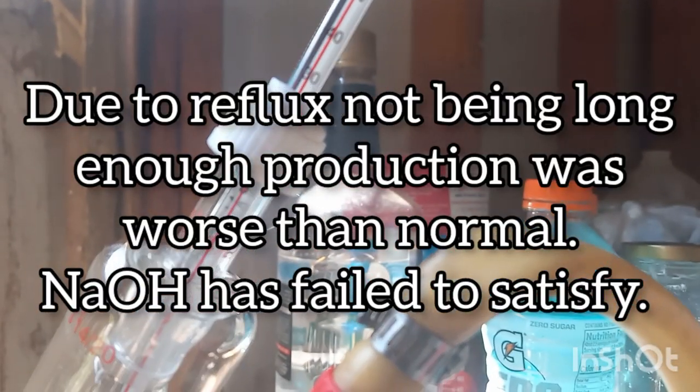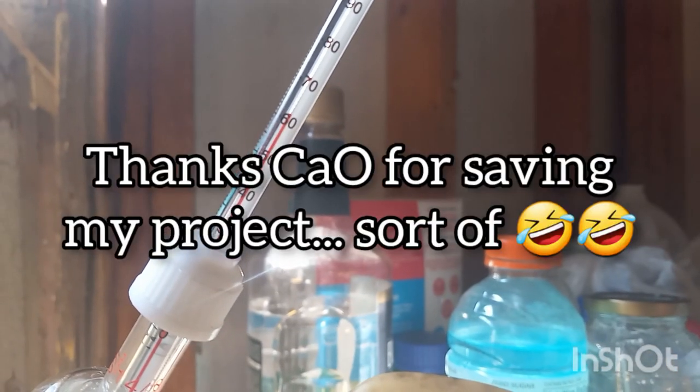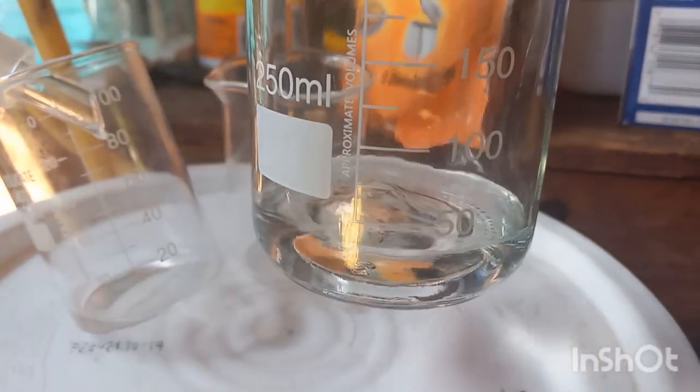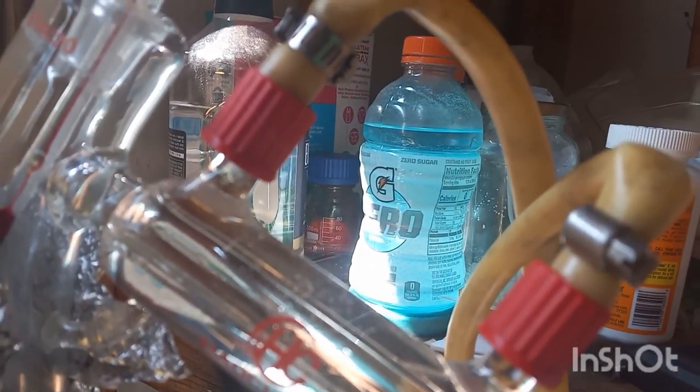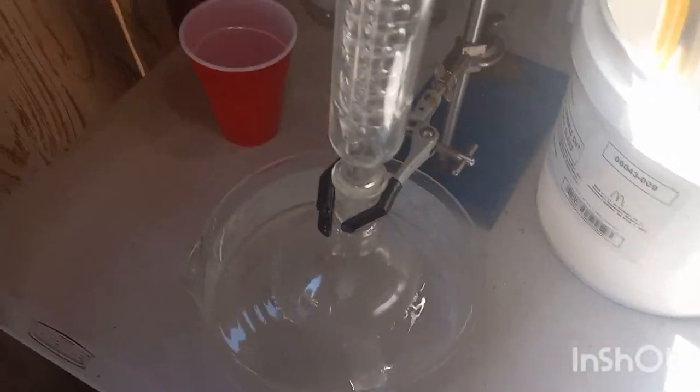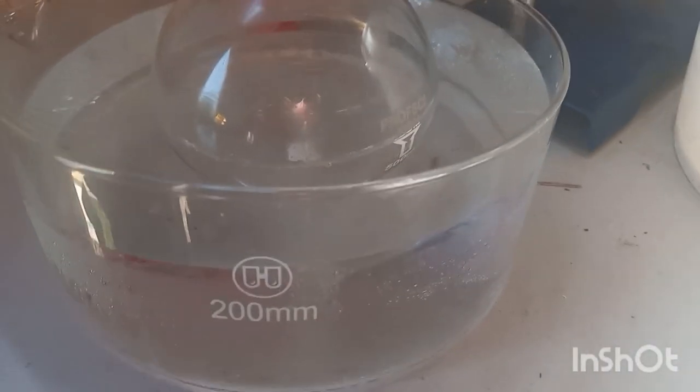Alright, looks like we are hitting the end, I suppose. It's dropping. So we got a little bit there, a little bit there. Definitely going to be a loss. Lesson learned, sodium hydroxide sucks as a transesterification catalyst.